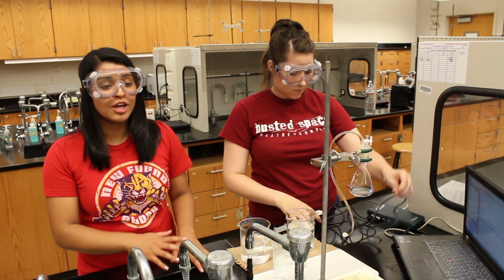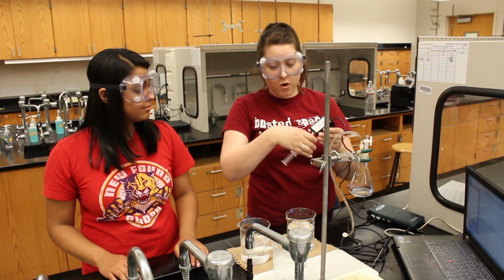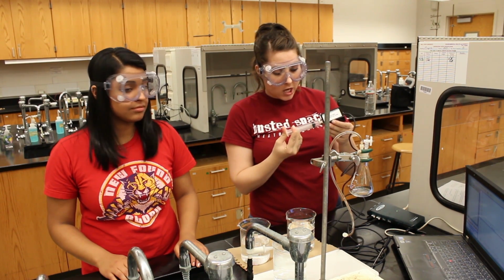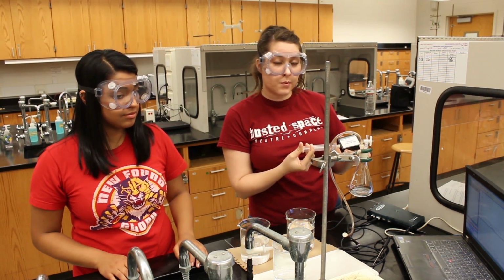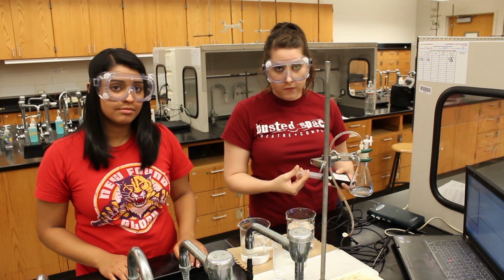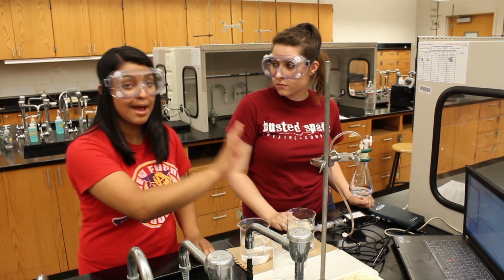Once you're ready to start collecting the data, click the Collect button at the top of the screen. When changing the volume on the syringe, you don't want to hold it where the gas is collected. And once it's changed, you'll want to hold it in place while the pressure stabilizes. Once it has stabilized, you can click Keep, record the volume, and hit OK. Now, if you mess up one of these readings, you can just hit Escape and redo it. Once you've collected all 6 measurements, click the Stop button.